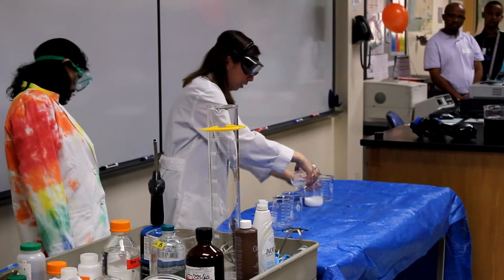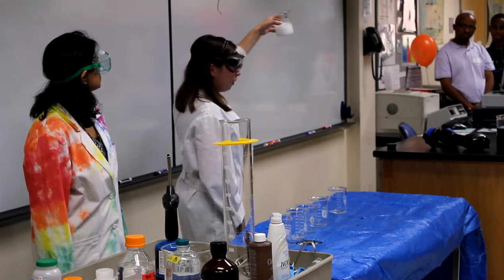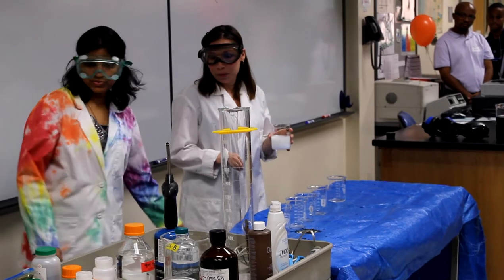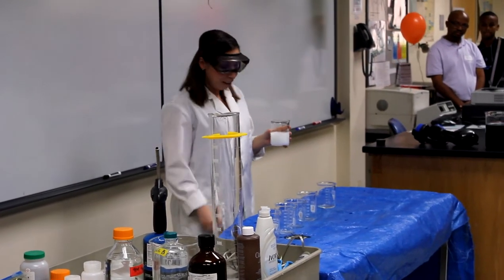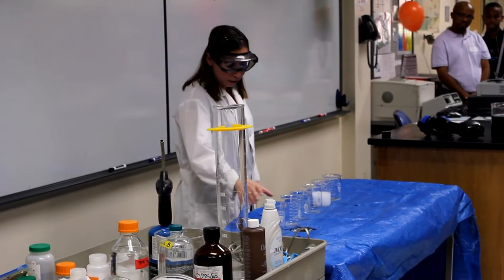Now I have my milk. So I turn 7-Up into milk. Oh, it's magic. Yeah, I don't think this is going to turn into Pepto Bismol without any. Sorry, so what we have is some different kinds of reactions here.